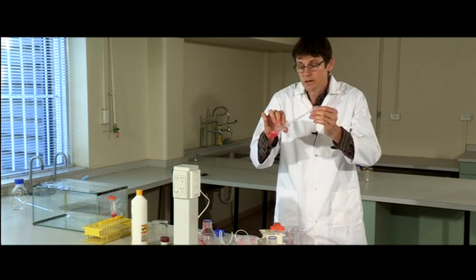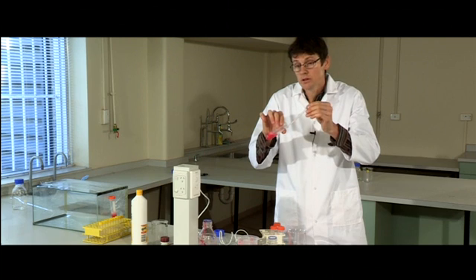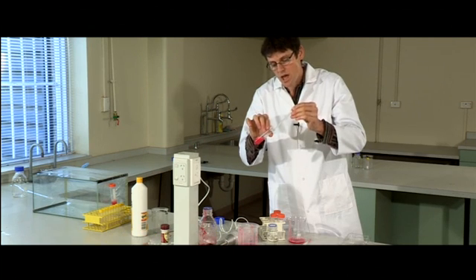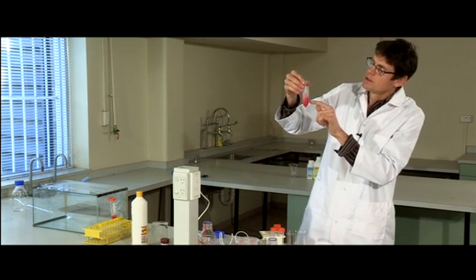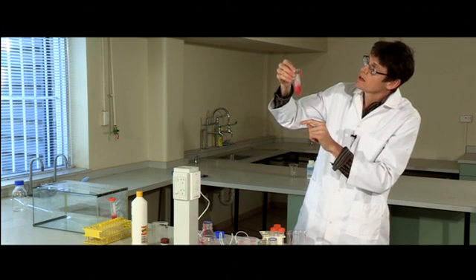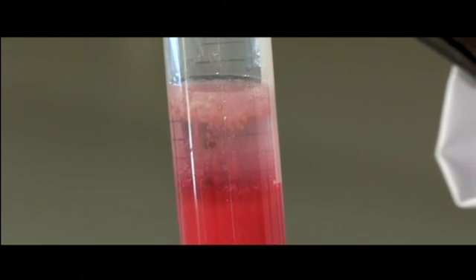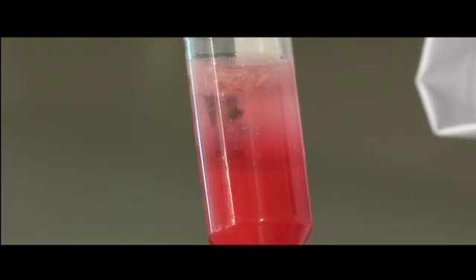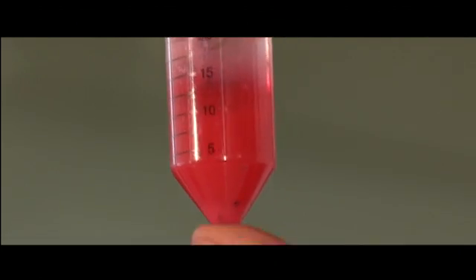Tilt your tube a little bit, drizzle the alcohol down the side, keep doing that. Now what will happen: the DNA is insoluble in the alcohol, it will move from the strawberry juice into the alcohol layer, and you'll see the DNA in the alcohol layer. It will be that very snotty, cotton wool looking stuff.